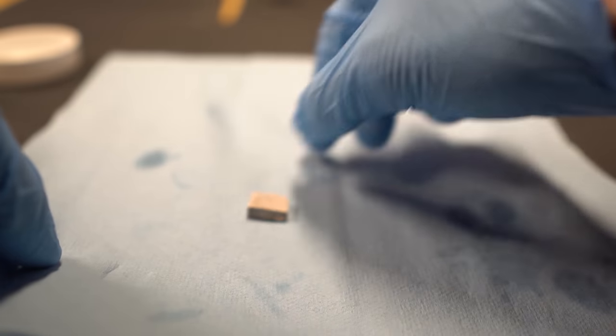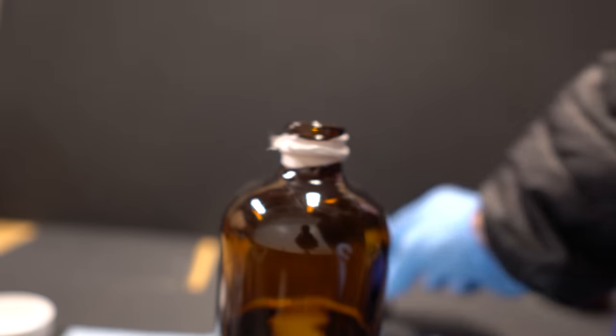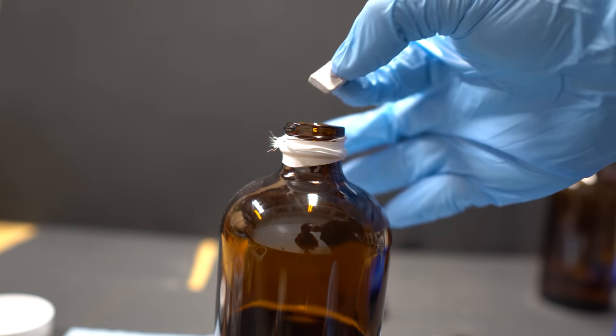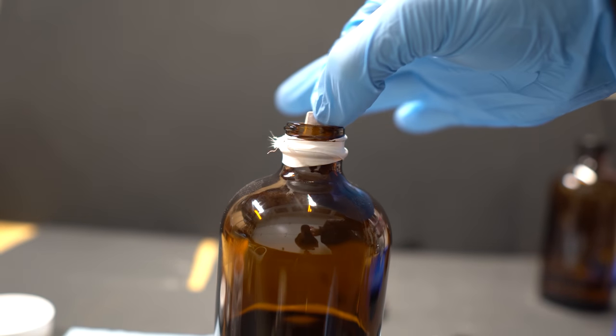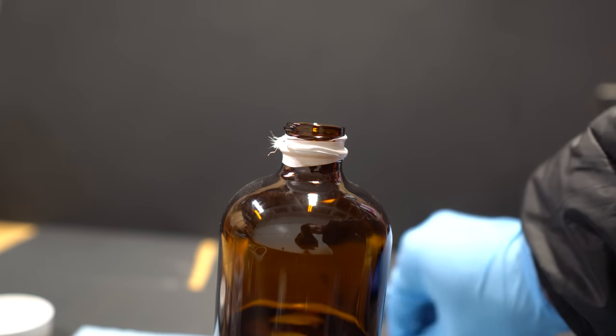Though the best way is to just keep it into the cans as it's sealed, it's kept away from moisture and oxygen and there's just CO2 in the can. A good idea would just be to extract when you need it and just do it in small batches.